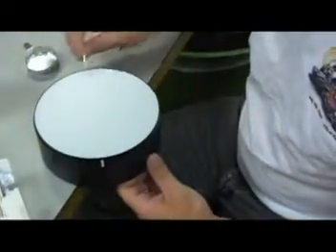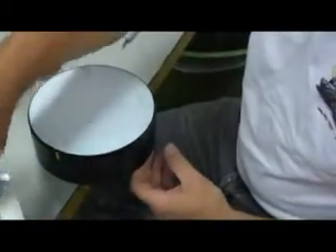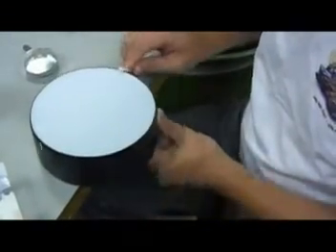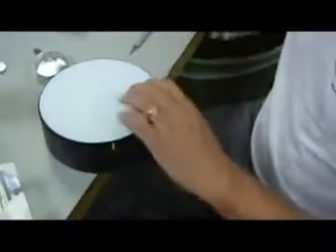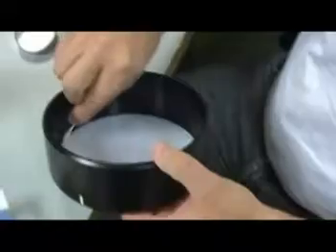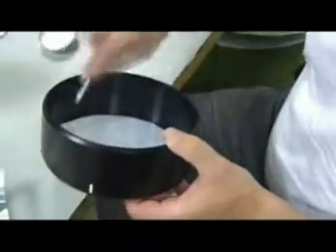This video was edited a bit. The entire process took about 20 minutes. Once we have everything cleaned up, what we're going to want to do is let that polycarbonate disc sit in the RTV and set. Usually 12 hours or overnight is a good enough time. Don't forget, we do have to clean the inside as well. And once we're done, you will have a sample dish that's as clean as new.